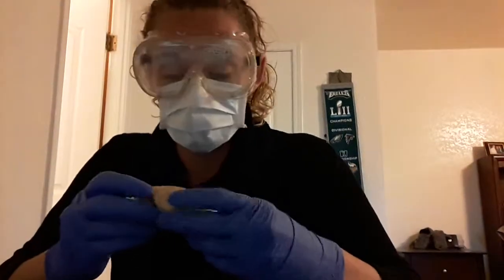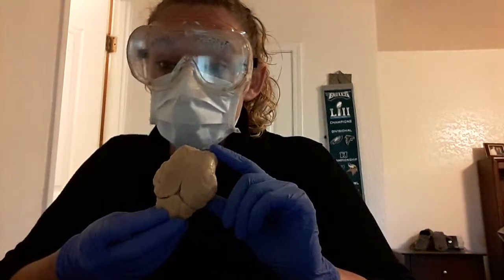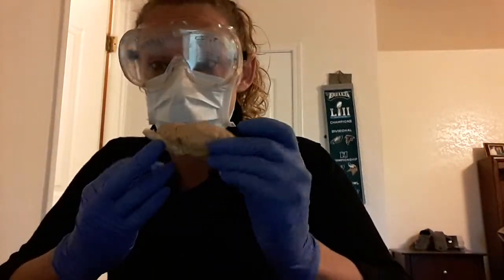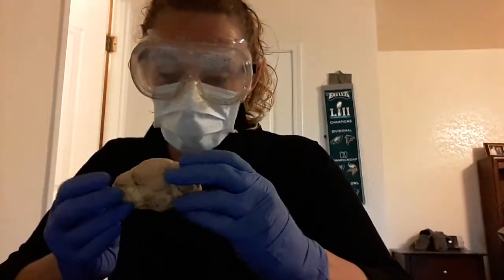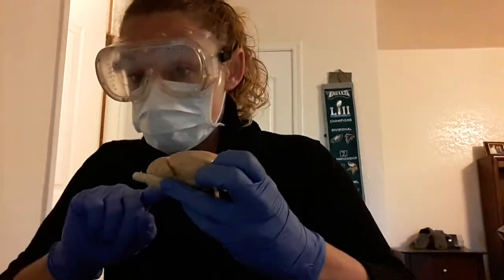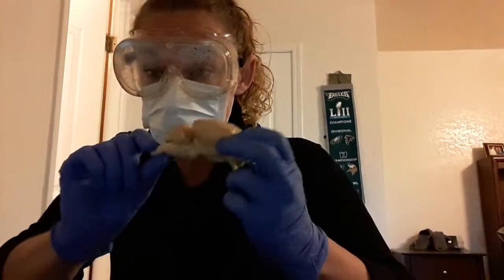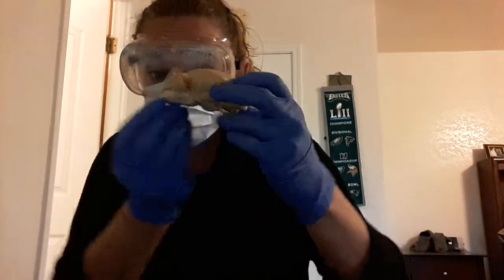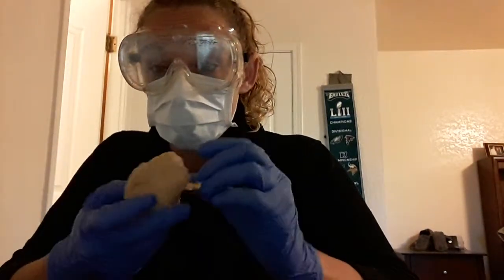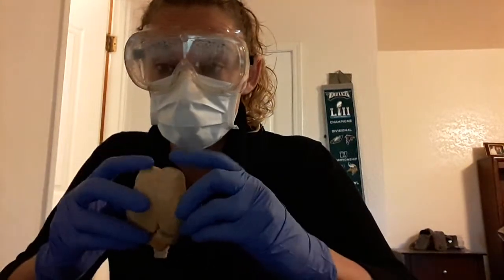Week 7 video, we're going to point out some structures on the sheep brain. Quite a few different structures. It's not quite like a human brain, but it's what we have to work with. Big difference is the spinal cord actually goes horizontal, and in humans it goes vertical because we stand on two legs. All right, so the frontal lobe of the sheep brain is up top here.